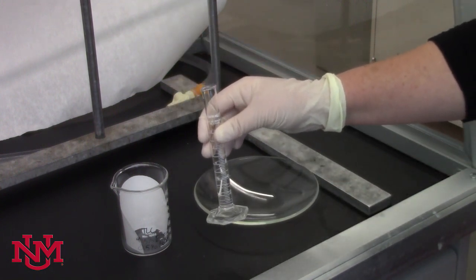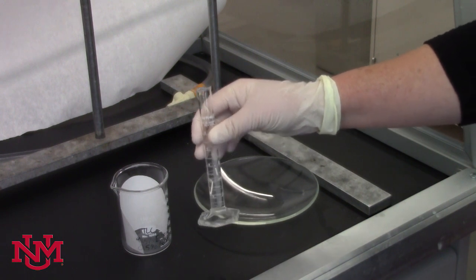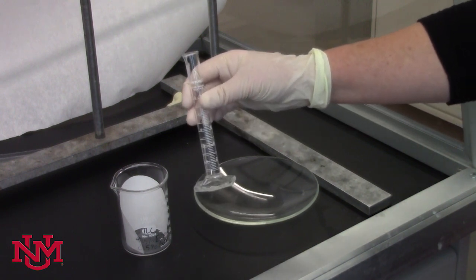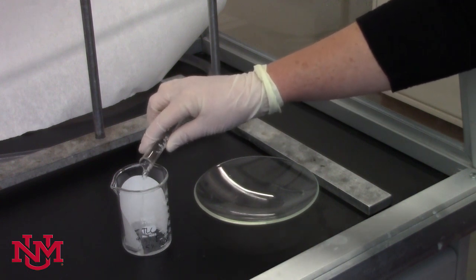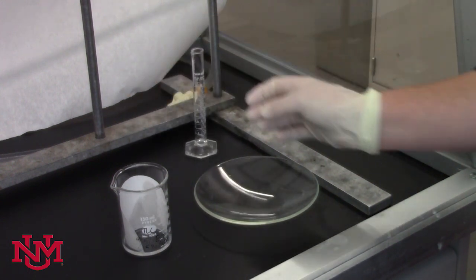We've already gone to the effort of finding out a good solvent combination for this experiment. You need a sample of that, about three to four milliliters. With your graduated cylinder, measure that out and pour it into the beaker to make your TLC chamber.